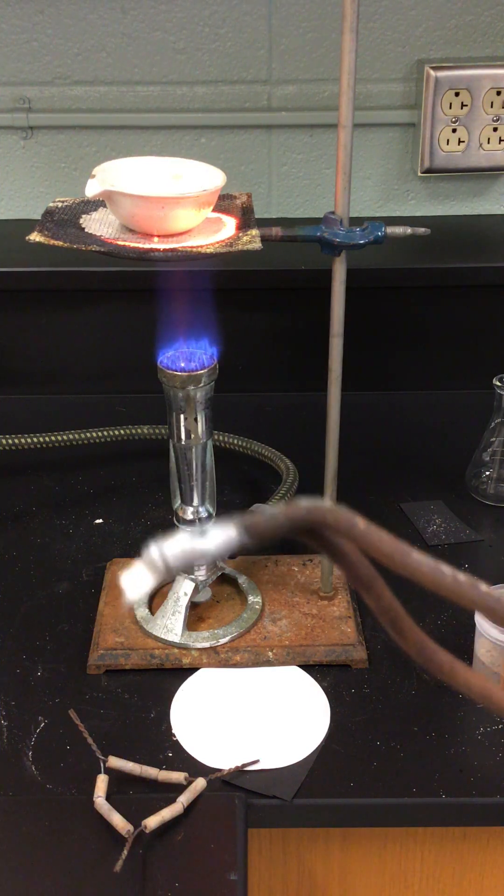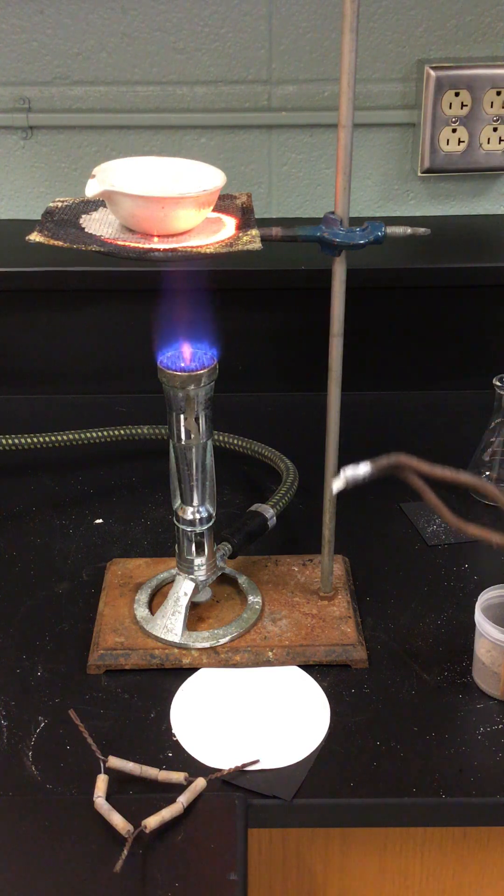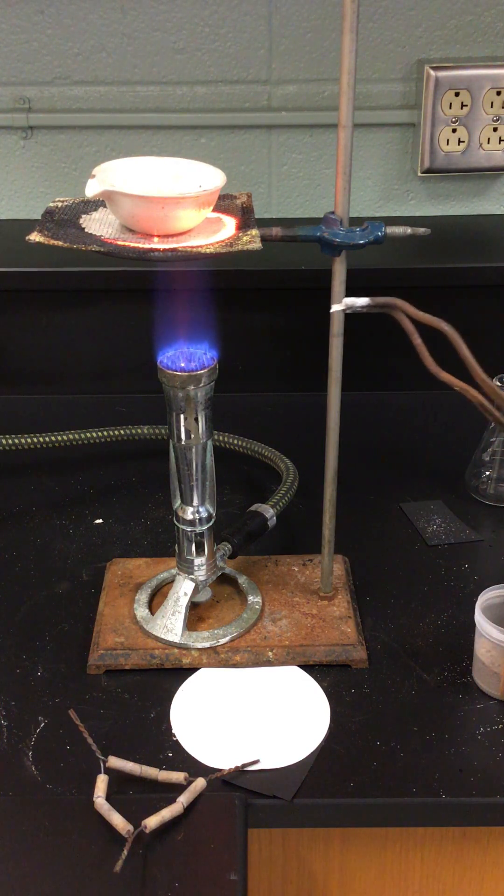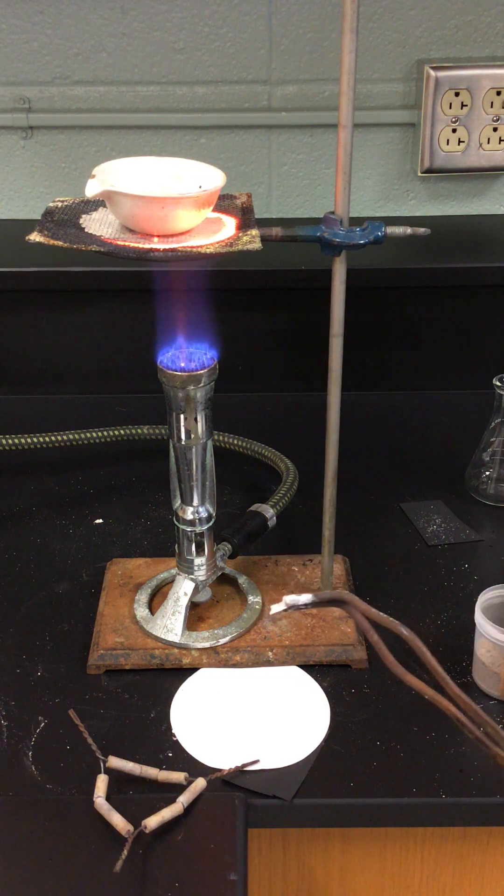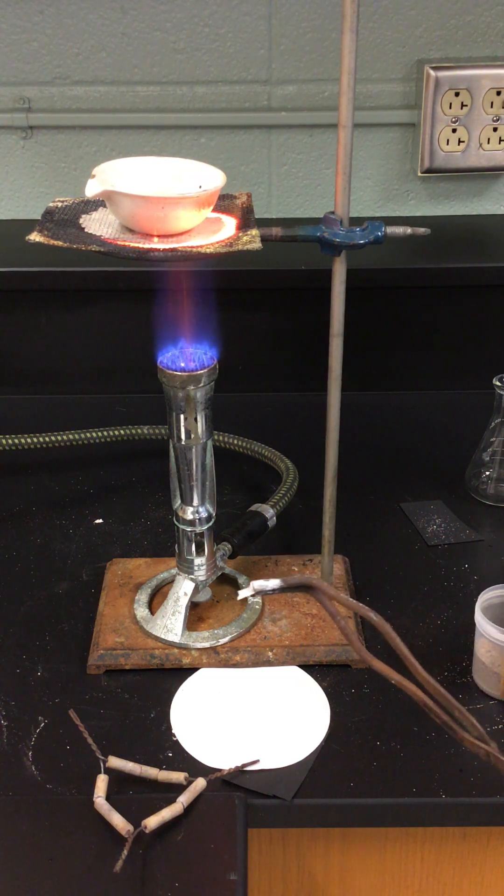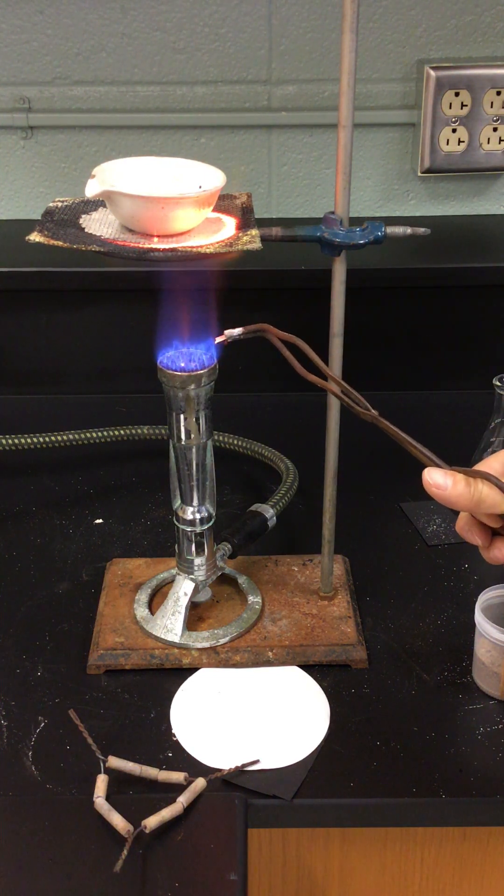These are both tiny tiny little pieces of magnesium. I'll show you, usually I have much larger and I've got this in another video, but you can see this tiny little piece of magnesium. This is boiling rapidly so I'm just going to light this on fire. This is for part, must be, I wonder if it's the third part.